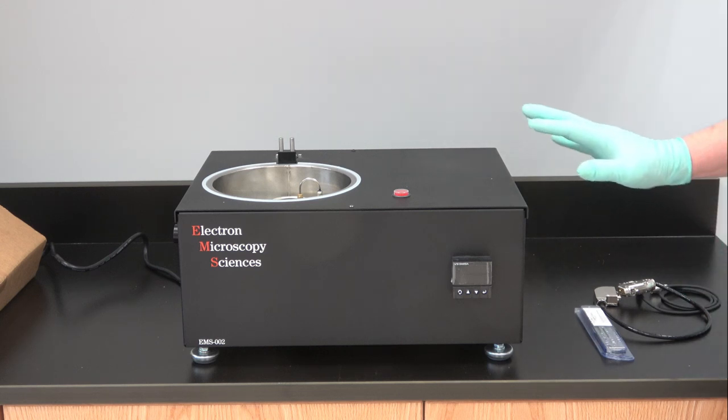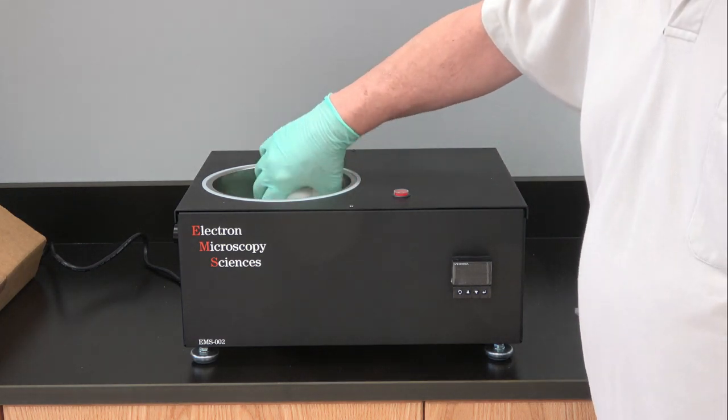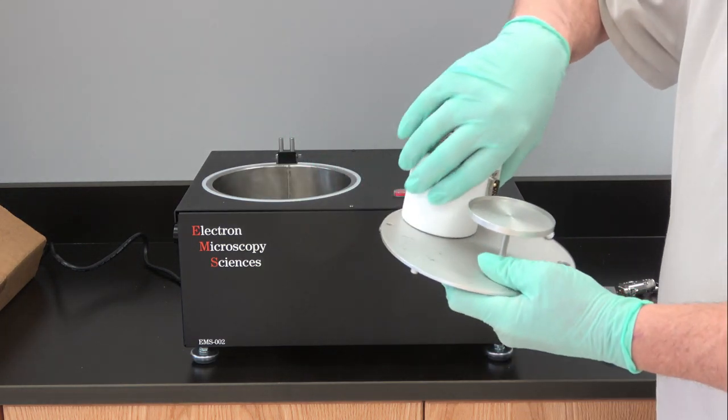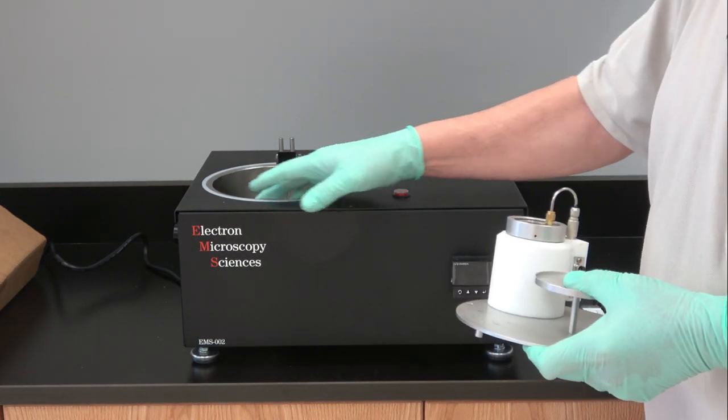It comes out of the box looking like this. It has the cryogenic insert which goes inside the stainless steel dewar here.